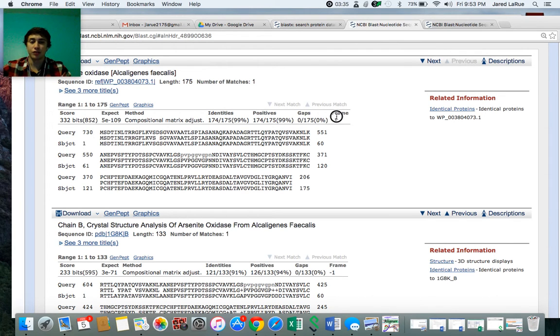One thing to note, this frame up here doesn't mean there's a frame shift. -1 just means that's where the reading frame started, at the -1 nucleotide, or maybe it started from the reverse. I guess -1 in this instance would probably mean it was read backwards, which actually makes sense here. It was read backwards at the very first nucleotide. It's fine, it really doesn't matter as long as it matches up in some way to the protein data bank, or to the amino acid data bank.